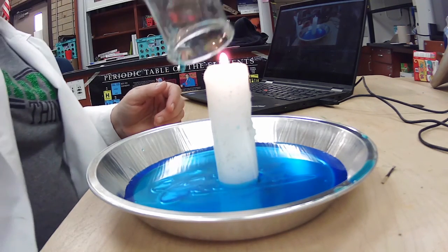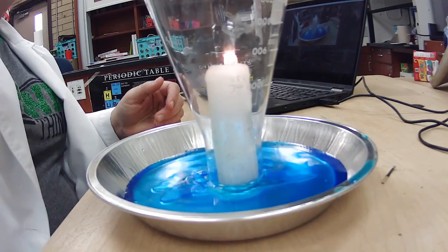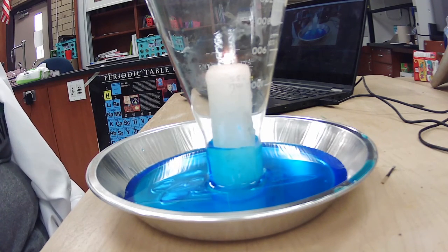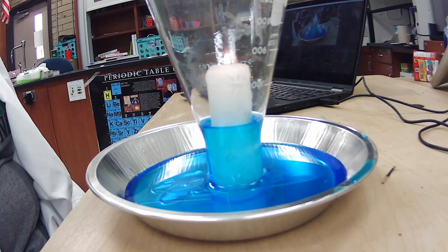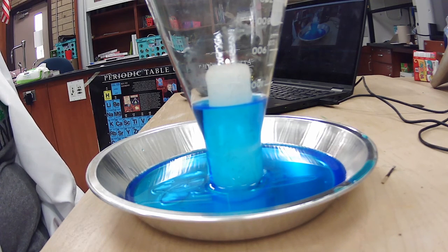So the candle, how is it changing the gas inside the flask? So what is it doing? So we're going to put it there. Let's watch and see what happens. Ooh, look at that. So what is causing it to happen there inside the flask? What is happening to the air? Because we're getting liquid that's getting sucked in.